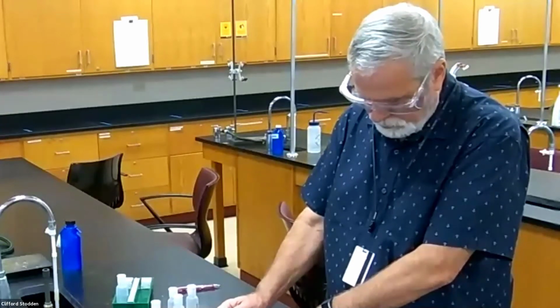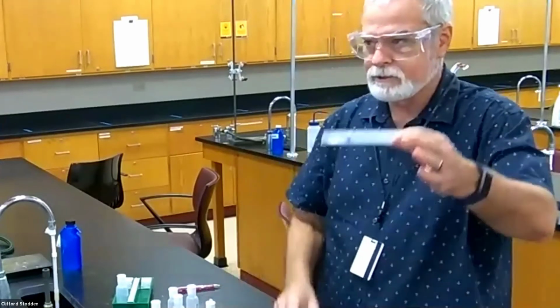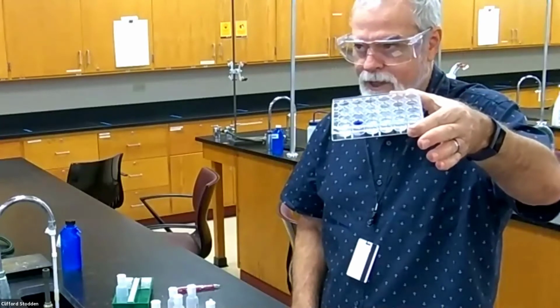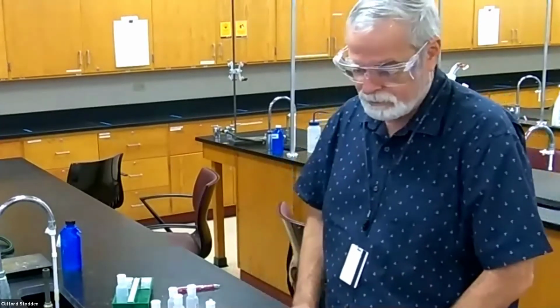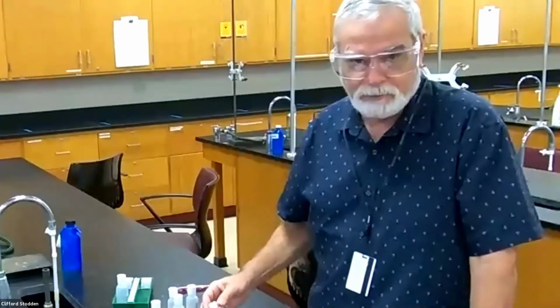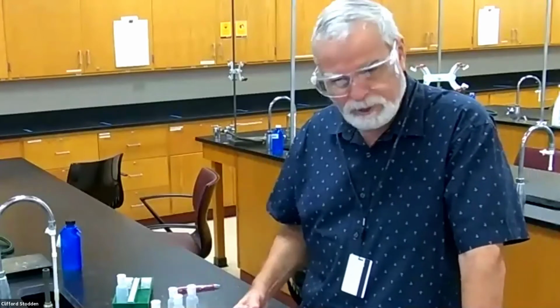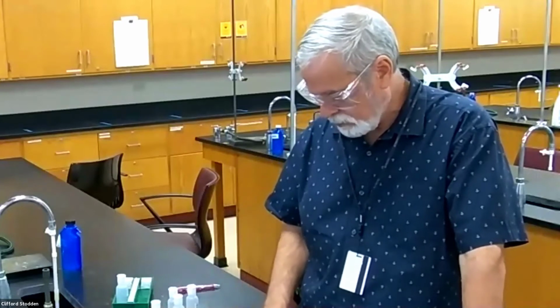And that's real interesting. What the ammonia does, you can probably even see it just from there. See that blue color? That's after adding ammonia. The ammonia actually darkens the color of the original copper solution there. Now that doesn't give me any other information, but it's kind of interesting because I already know which one the ammonia is and I already know which one the copper is. So I didn't get any more information from that, but that is a reaction. It forms a darker blue.